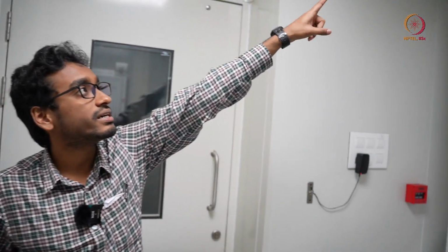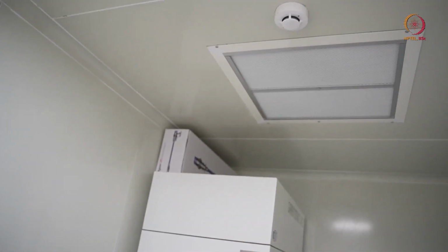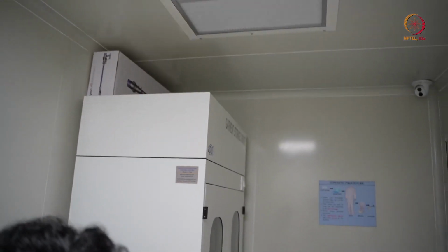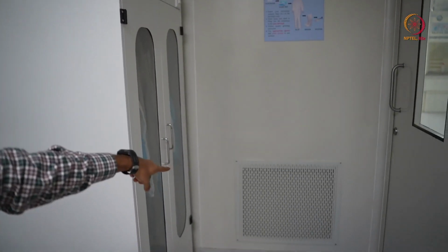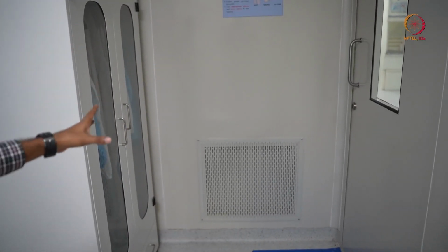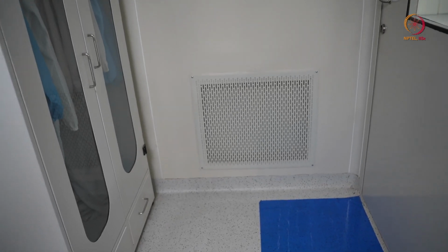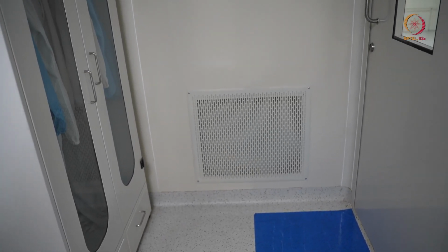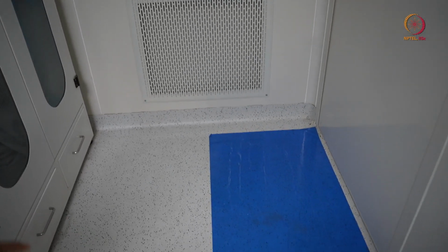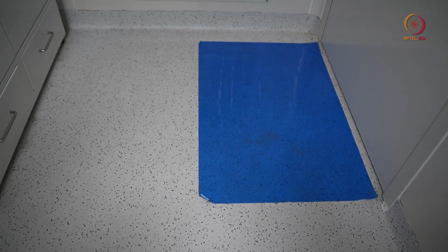So see here, this is the inlet, so air will come in, laminar flow, so that is one, and after this it will go there, that is the exit. So it will maintain a recirculation process. The ducts and everything are inside that wall, in between or above this floor, sorry, or above this. And here there is a sticky mat, that blue thing, I think you can find it, pretty interesting stuff.